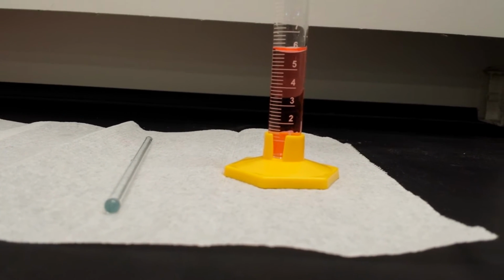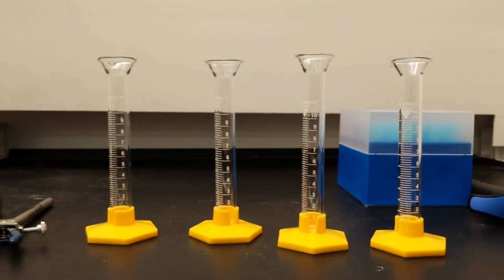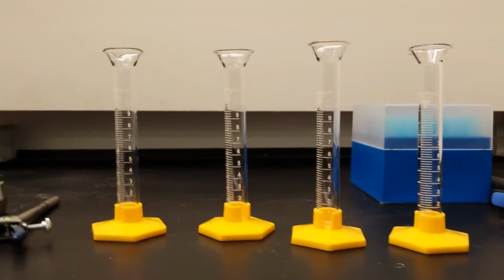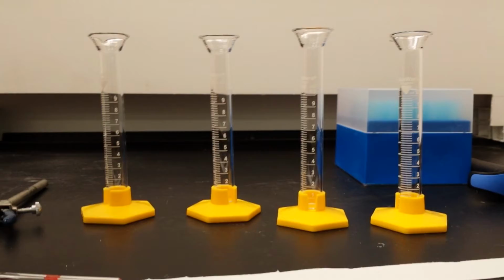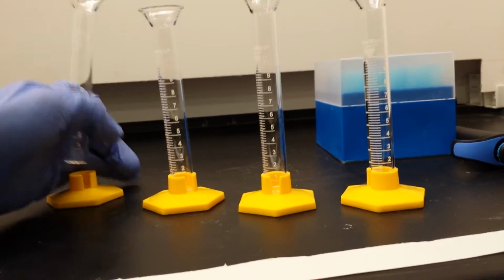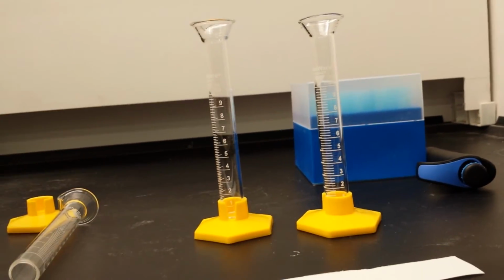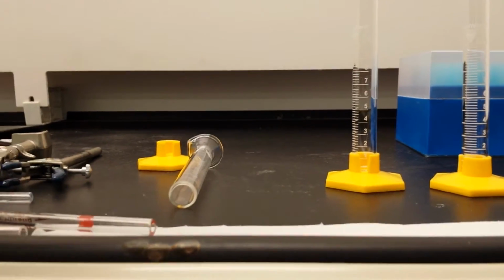But here's why you don't want to believe that at all. So I just grabbed 4 of these completely randomly off the shelf. There were the first 4 sitting at the front of the cabinet. Now, these bottoms all come off pretty easily. Basically, they're just kind of like test tubes with a little base as a holder to keep it upright, with a little bit of a square bottom to it.